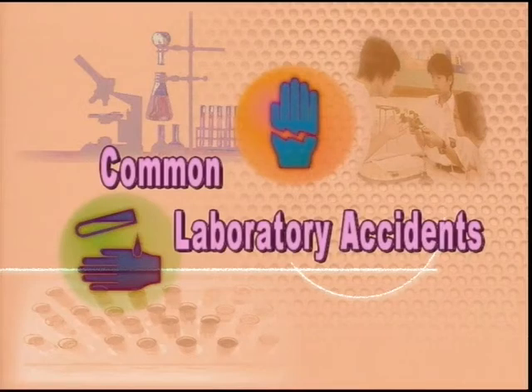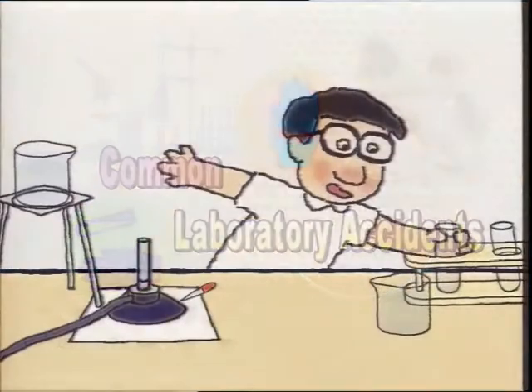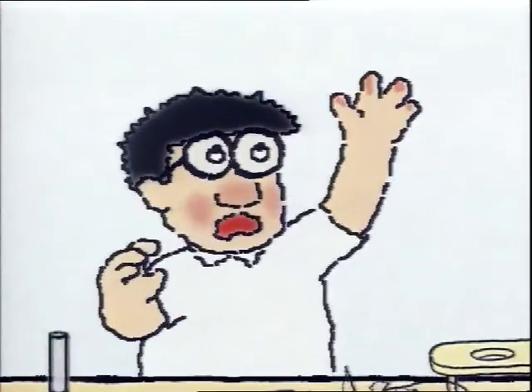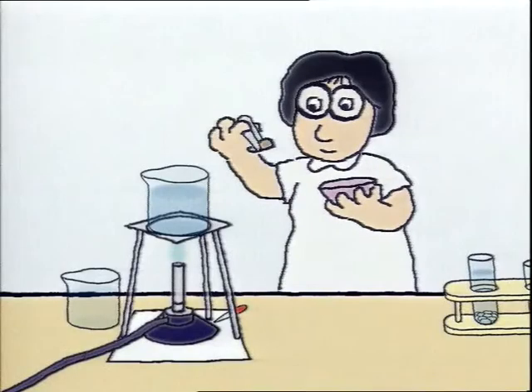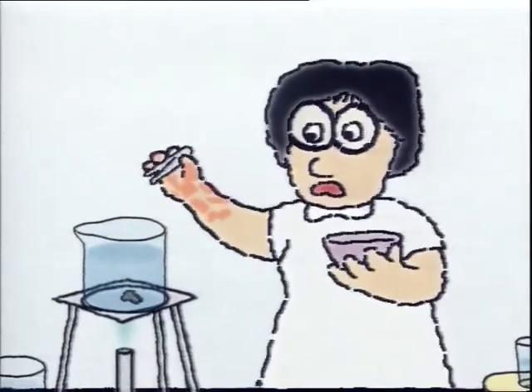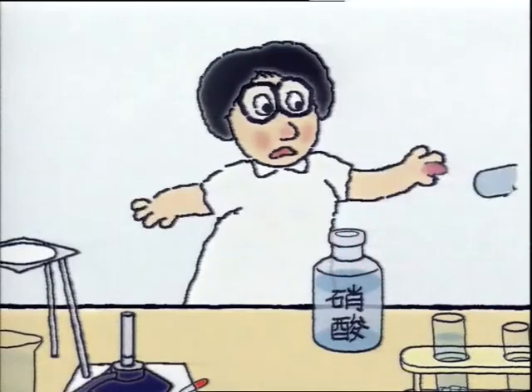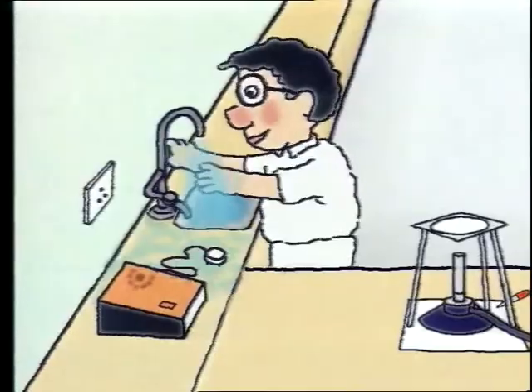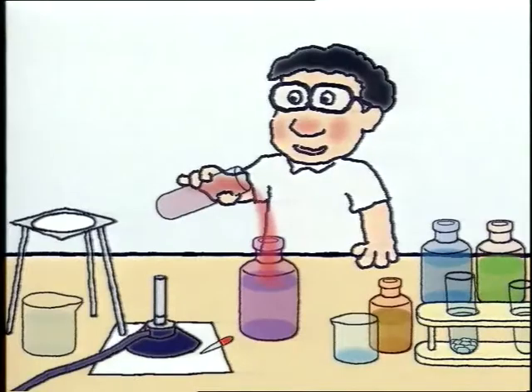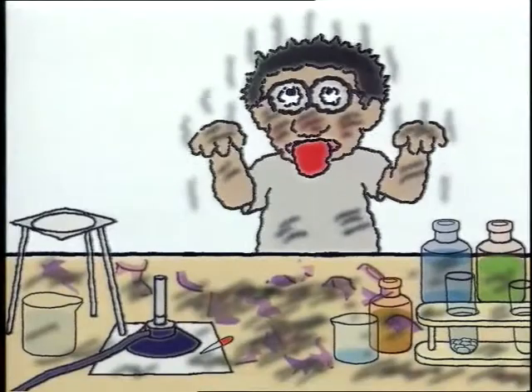Let's see what are the common accidents in the laboratory. The student is cut by glass or other sharp instruments. The student is burnt by a Bunsen flame or hot liquids. The student is burnt by corrosive chemicals. The student is hurt by an electric shock. The student is hurt by a small explosion when mixing incompatible chemicals.